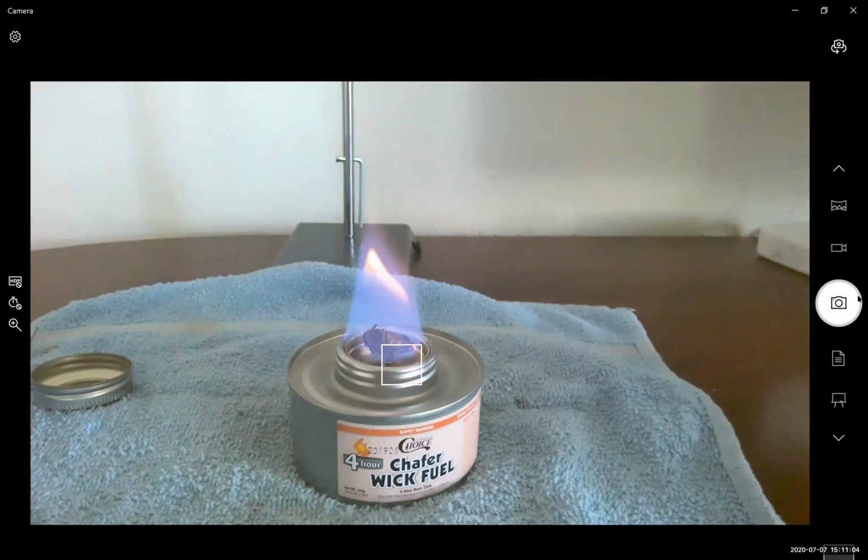Okay, now I'm going to show you a bonus one. Looking at the solutions that we have, let's see, do we have copper? I'm going to look and see if we have a copper solution. Well, we don't have a copper solution. Let me pause for a moment and I'm going to show you what copper looks like.